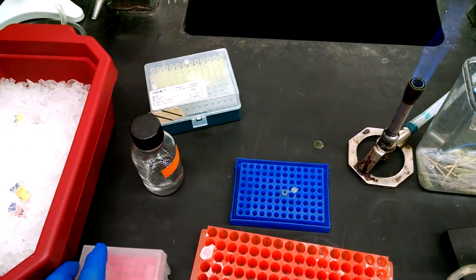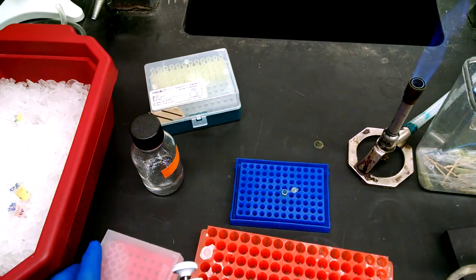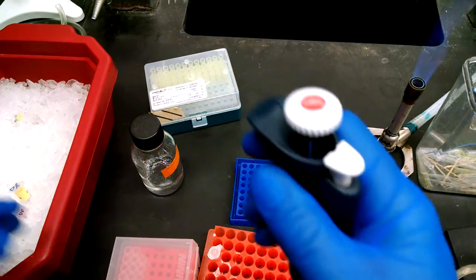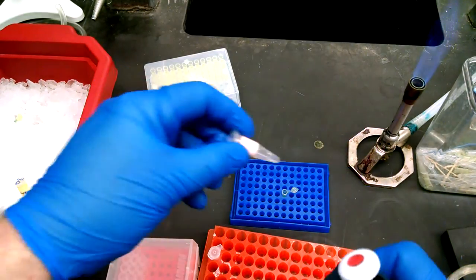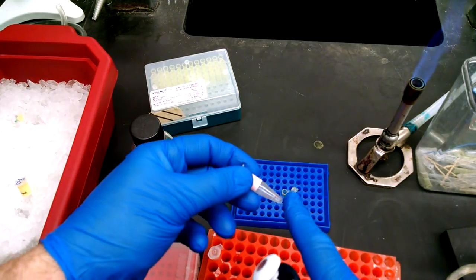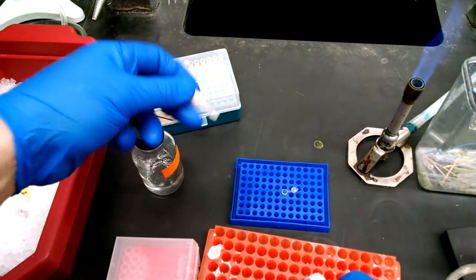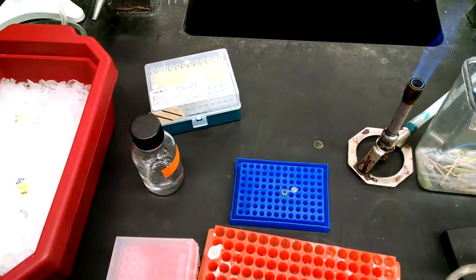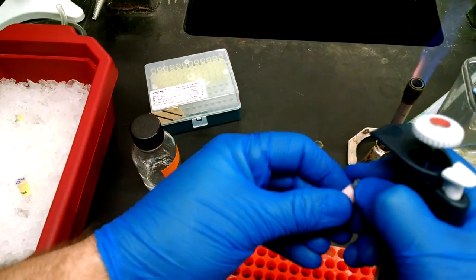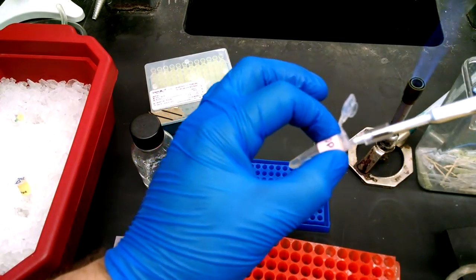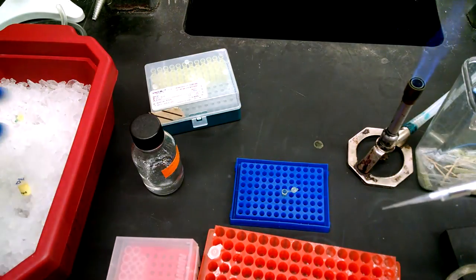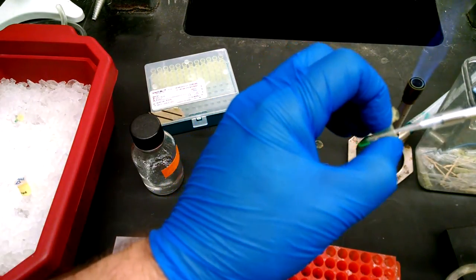So we've got our template DNA. Now we want to add our primers. So we have primer one, that's the up primer. If this was on ice and it was just provided for you, make sure it's not frozen. It should move. Now you can vortex these if they're just fresh from the freezer. It's okay to do that. A little bit of DNA, you can give it a quick vortex. Again, one microliter. A little hard to see, so be careful. Make sure it goes into the sample.